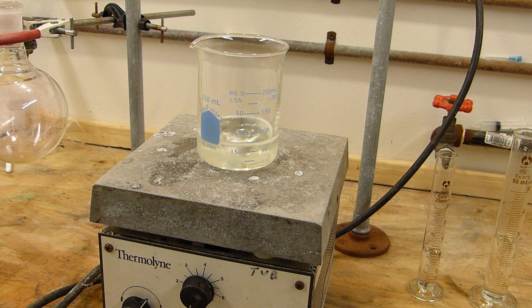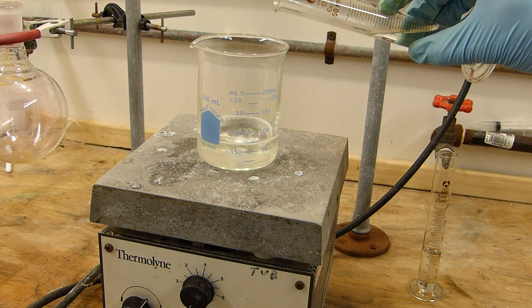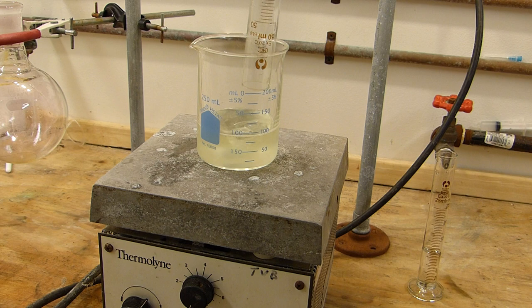You can see the potassium iodide has almost completely dissolved now, so I'm going to go ahead and add the 25 milliliters of 25% hydrochloric acid slowly.